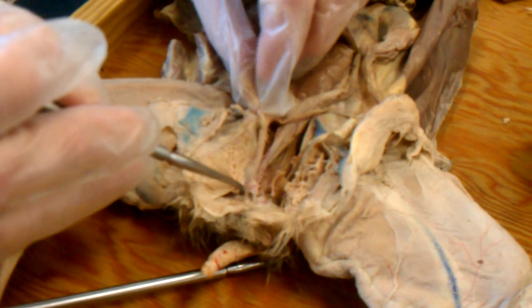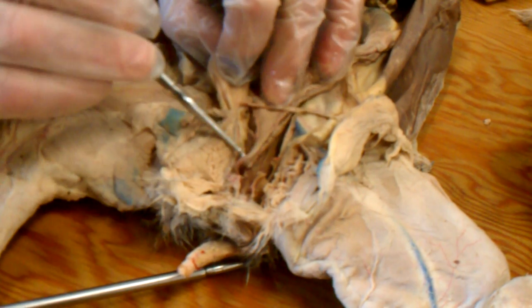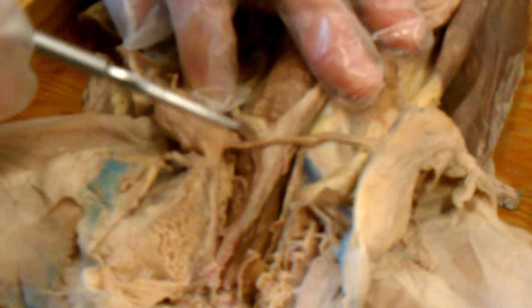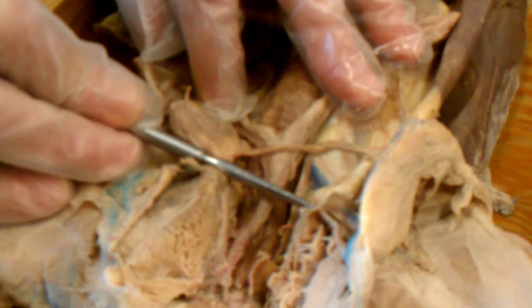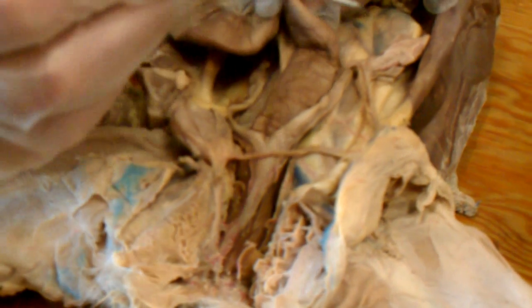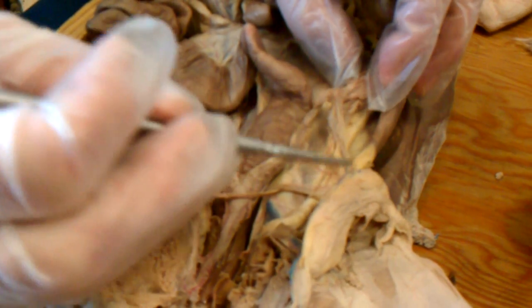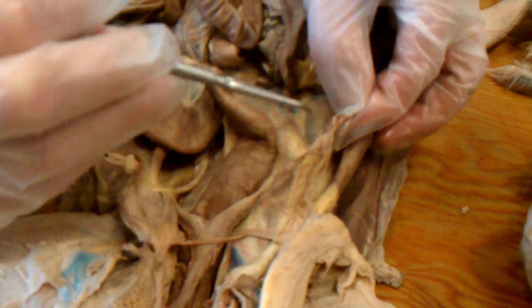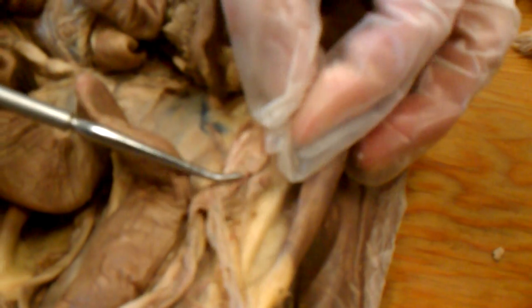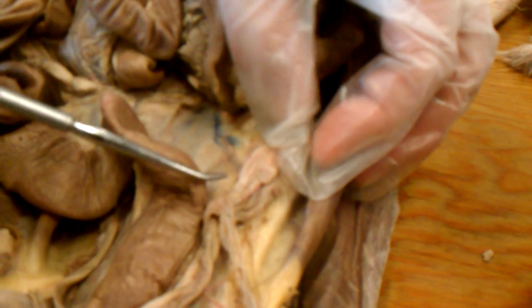All right, so we had urogenital sinus, urethra coming out of the bladder, the vagina passing through the pelvic canal, the body of the uterus coming out just above the pelvic canal and separating into horns of the uterus, held in place by a broad ligament and a round ligament to the side. At the top of those tubes is the ovary, and lateral to it, the uterine tube curves around the ovary, held in place by a little mesentery called the mesosalpinx.